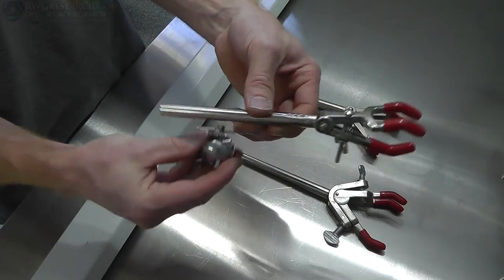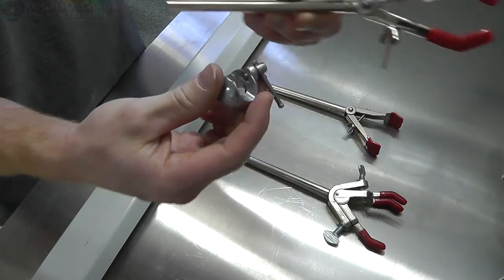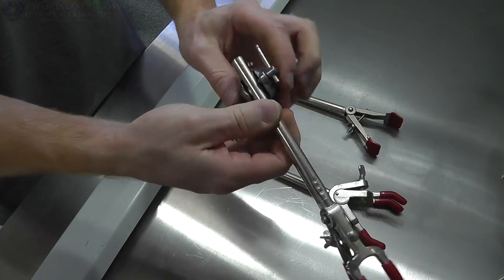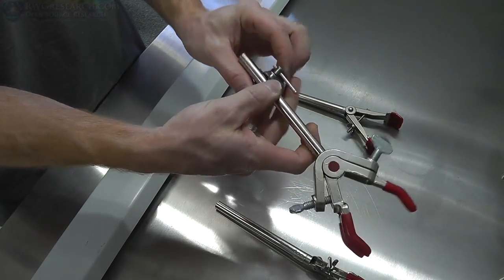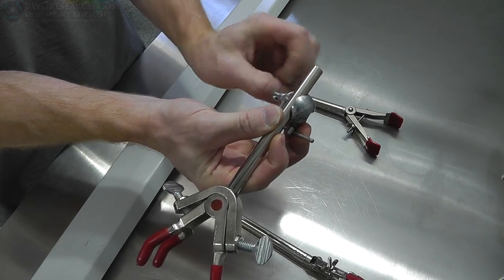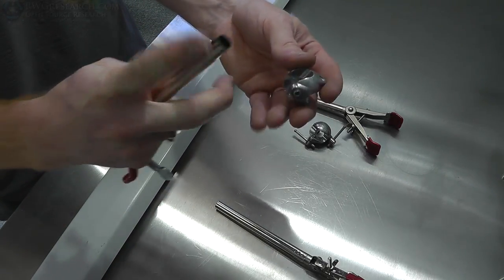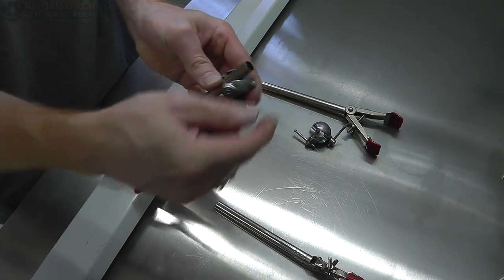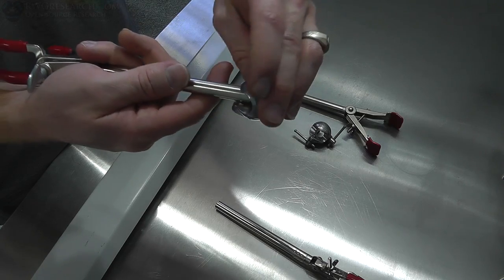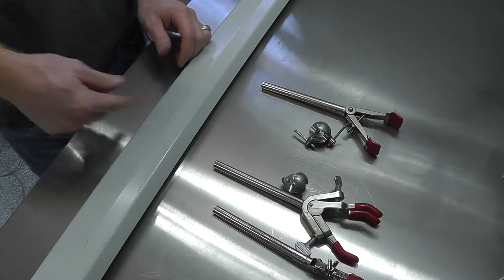And then to attach the back, I'm actually just using the same things I used on the structured lattice. These particular ones have, I can't use that one and that one, huh? That's not going to work. It won't go down far enough. So apparently these don't thread down far enough, but these do. These are the ones you use with Allen wrenches, so I'll have to do something different with those. But basically, I'm going to use these same adapters. I could stick it in the middle, or I could stick it in the side and mount it wherever I wanted. So I'll show you the difference between these.